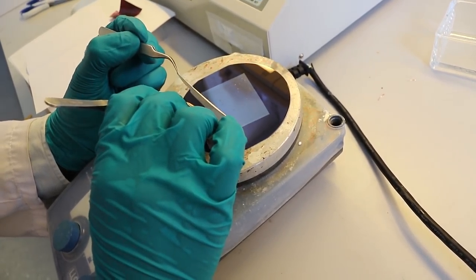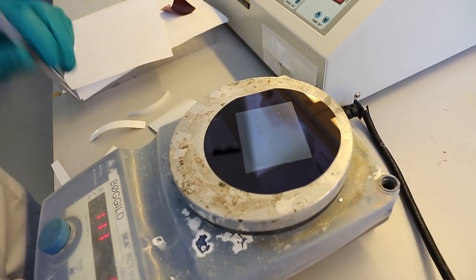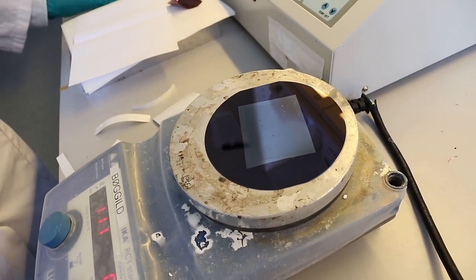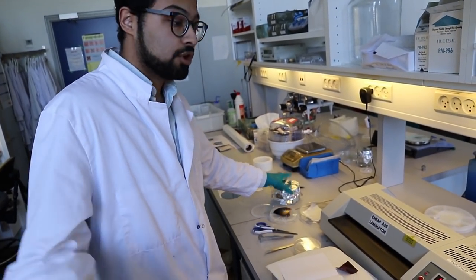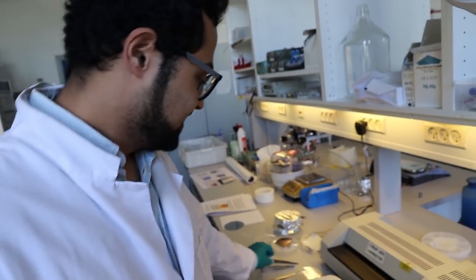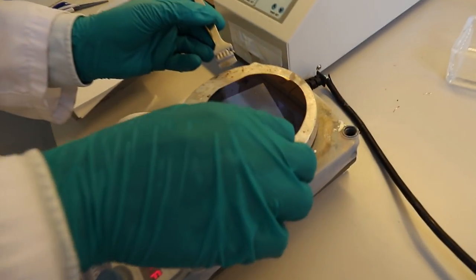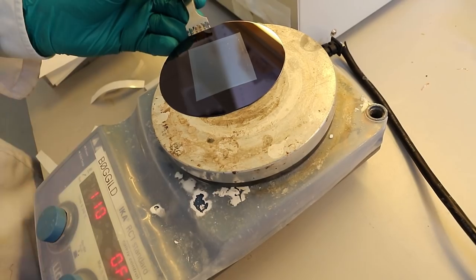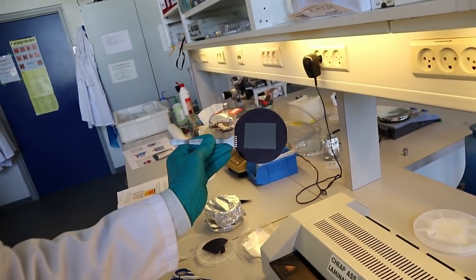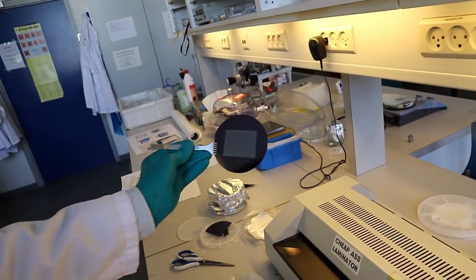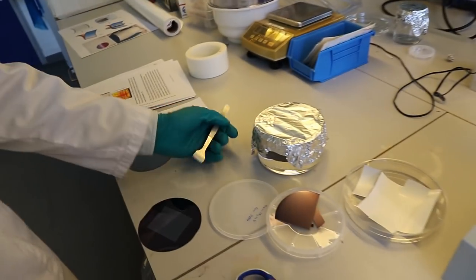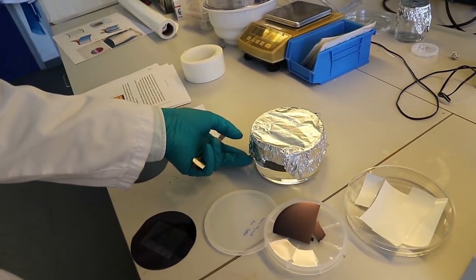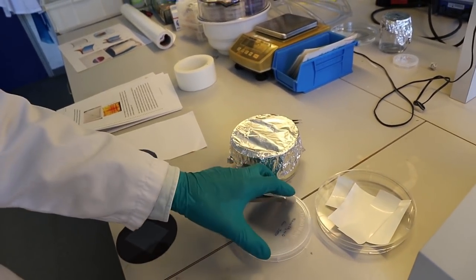Yeah, the PVA is still on the silicon dioxide and the white foil helps to maintain a rigid support when you're laminating this. Why is PVA a good choice? Because it's water-soluble. So instead of using acetone or other solvents which you need to work in fume hoods with, you can just store your solvents outside in a dish like this. The water is pretty cheap. There we have our transfers. We will now put this inside. So you dip it in the jar there. How long does it take for the PVA to dissolve?